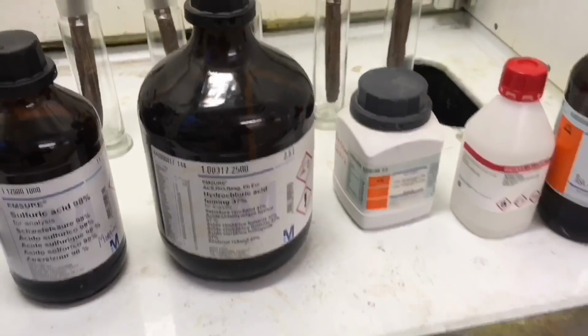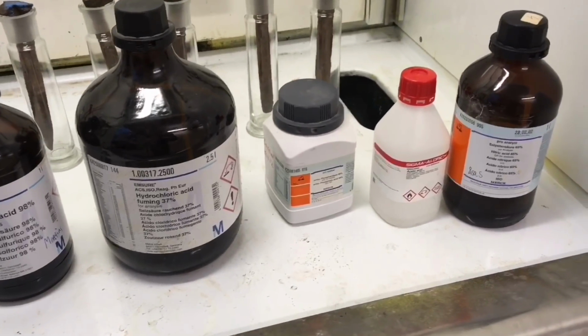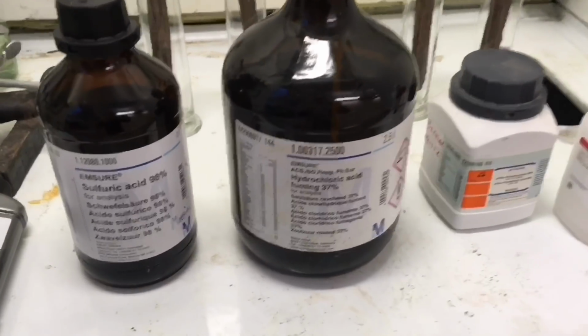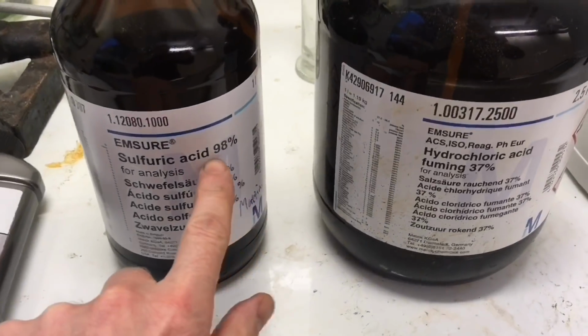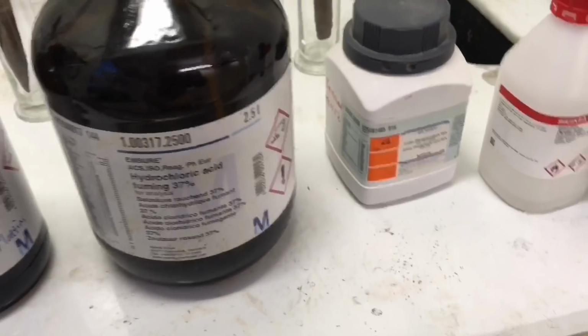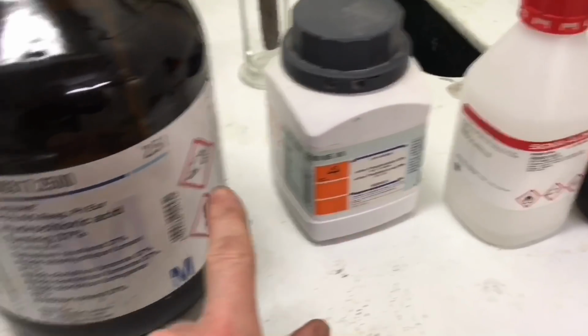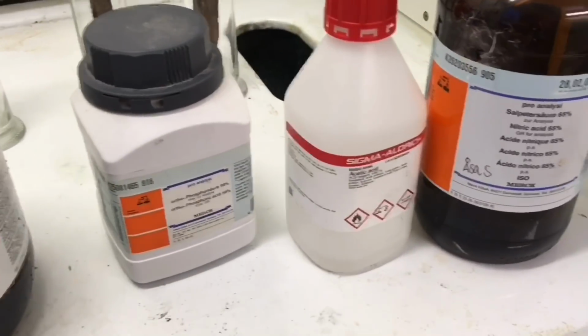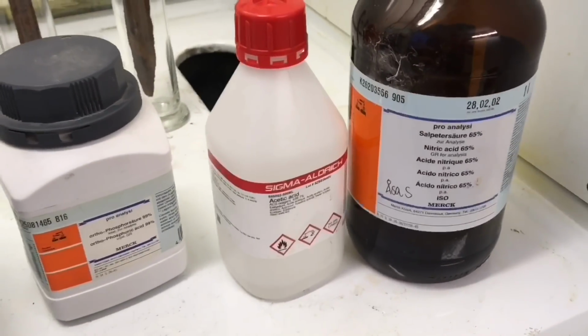But before I actually continue this video, I'm going to tell you a little bit how we will have to set the standard, because this one, as you see over here, says 98%. How can we compare that to something which is 37%? Or for example, this one is 100%. I mean, this is as concentrated as it gets. So I'm going to normalize these to the same concentration level.